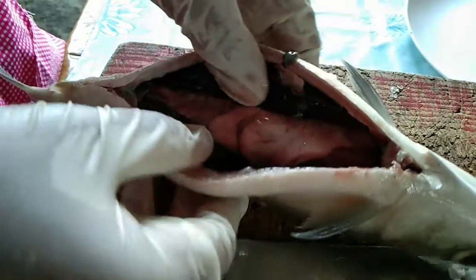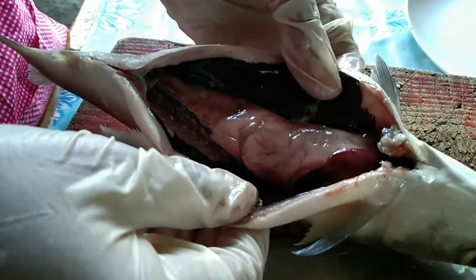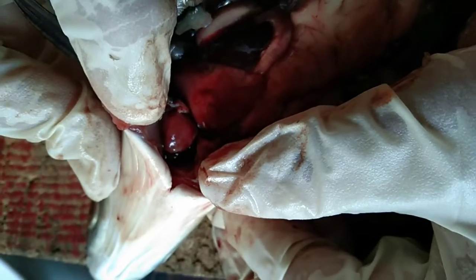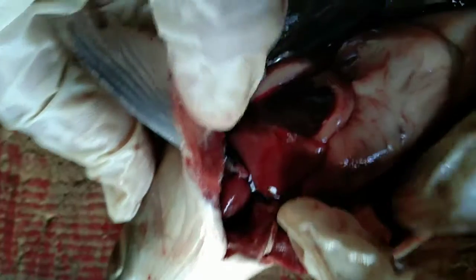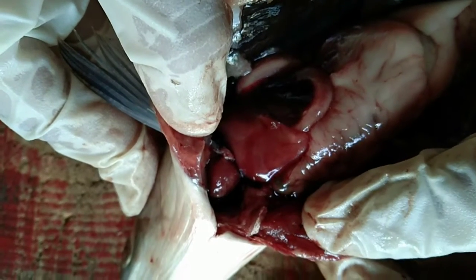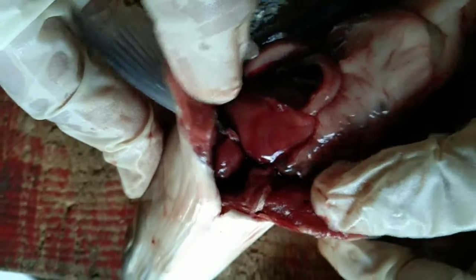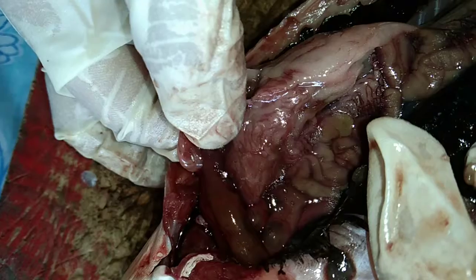This is the internal parts of the fish. This is the heart — it circulates blood throughout the body. This is the liver. The liver assists in digestion by secreting enzymes that break down fats, and also serves as a storage area for fats and carbohydrates.